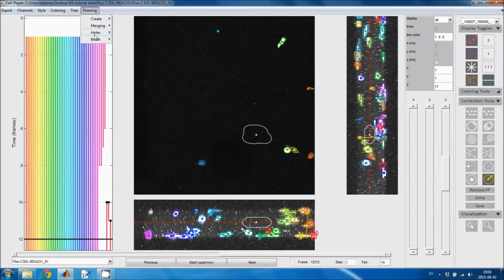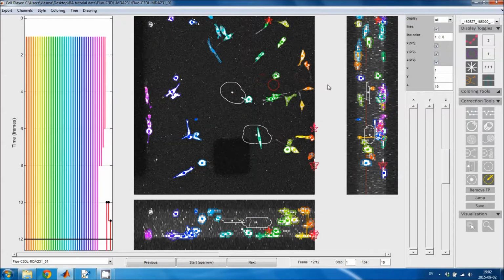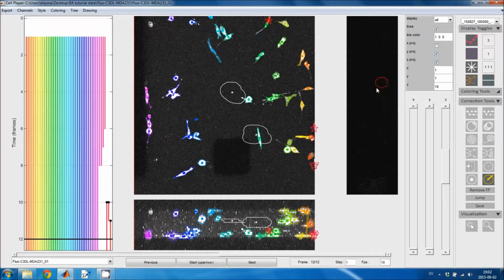If I'm editing using the disc-shaped brush and I create a new region like this, then I can go to the next Z-slice and just draw on top of it, and the two regions will be joined into a single volume, as long as I click on top of the other region. And if I'm using the disk-shaped object, I can do the same thing in all 3D views. It doesn't matter that I'm in the X projection or the YZ view here. The disk becomes a circular disk in this view and a single plane in the other views.